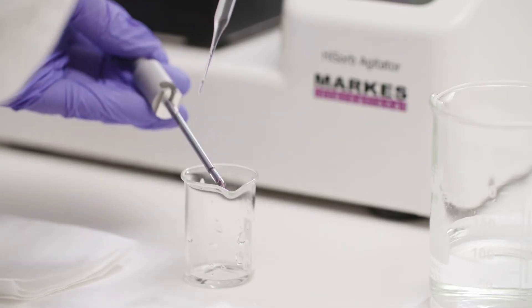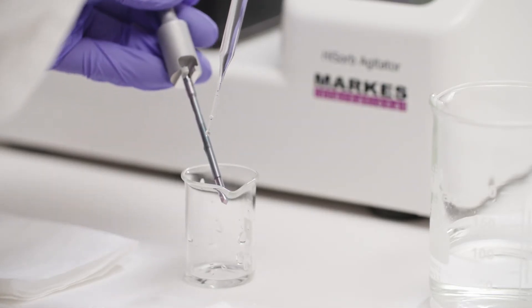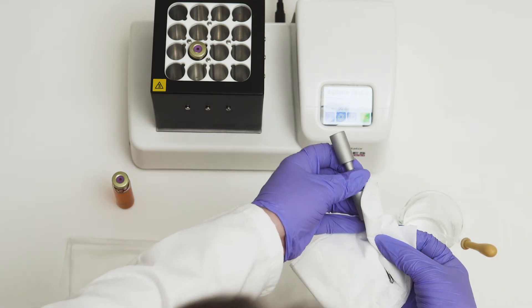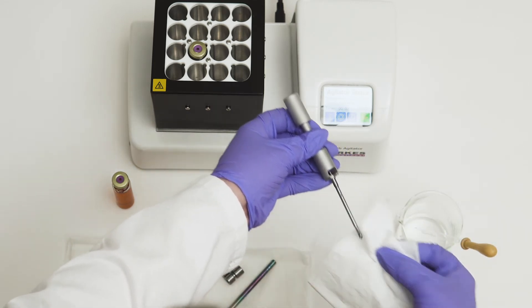Wash the probe with water to remove any sample matrix. Next, dry the probe using a lint-free tissue or blasts of clean air.